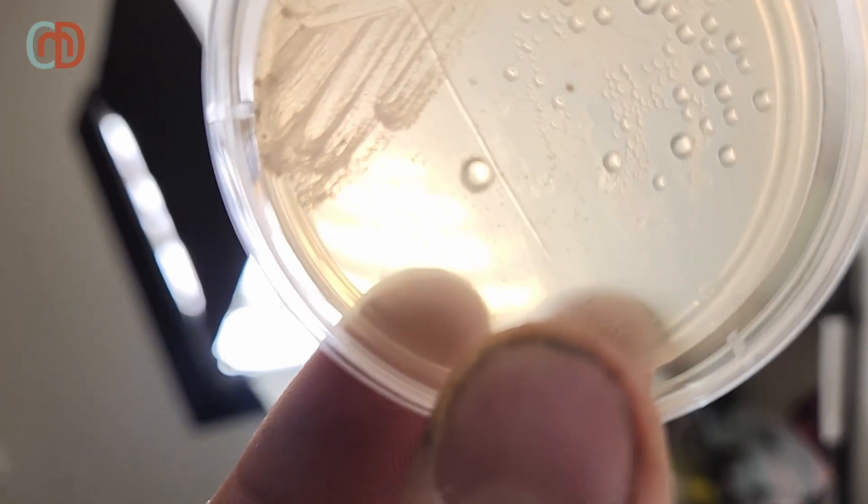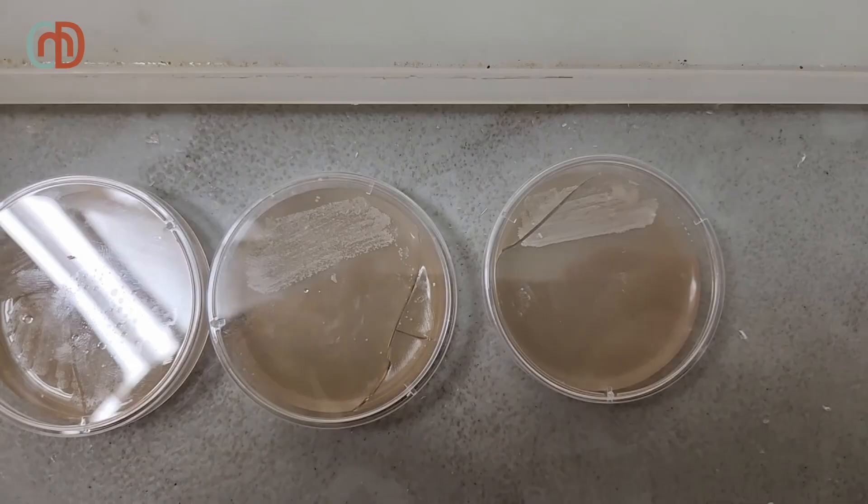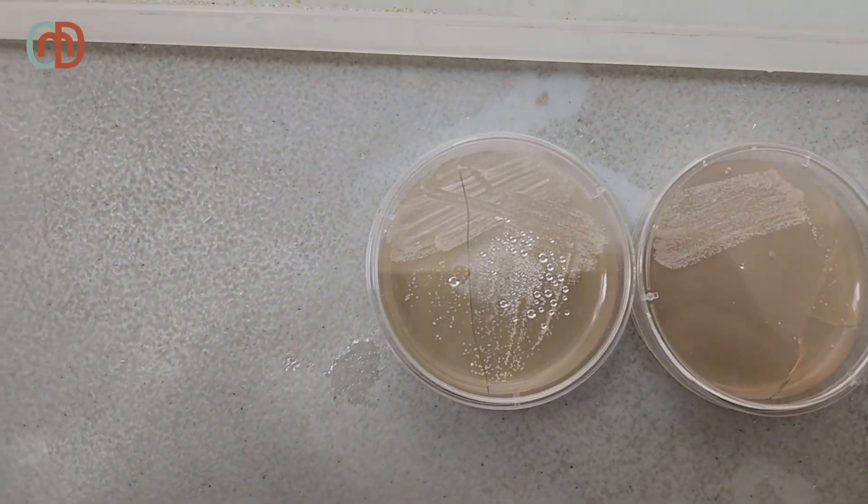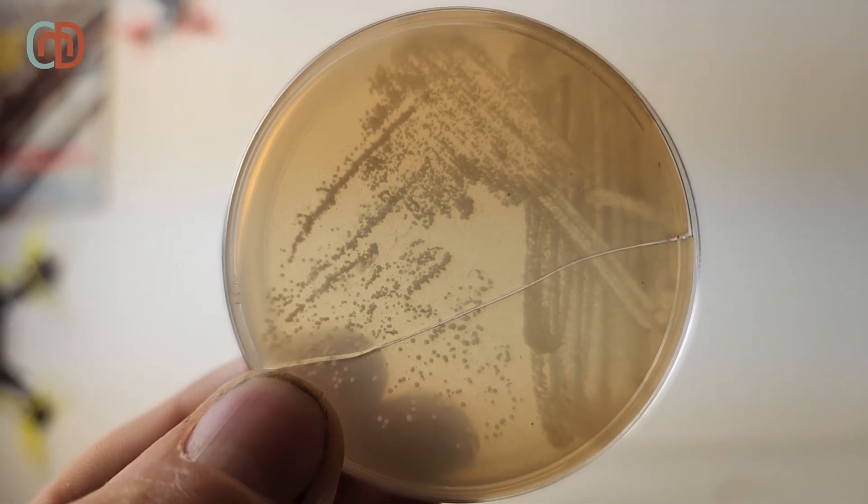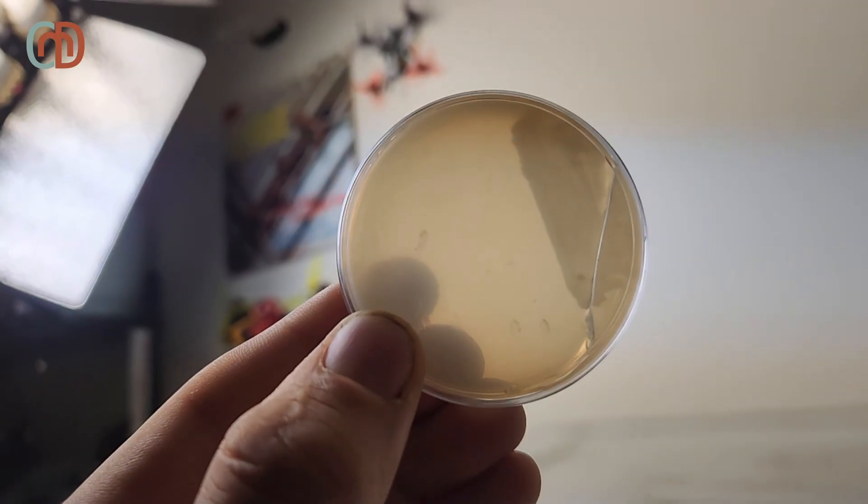24 hours later, I notice that the growth wasn't enough for me, so I gave it another day. Here's 48 hours in. Notice that some of the streaks are high density, while others have low density. That's just because I'm bad at streaking.